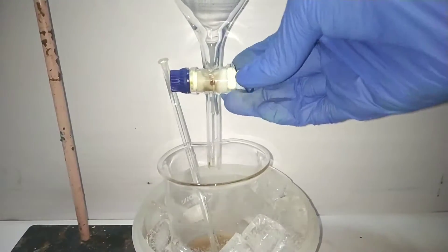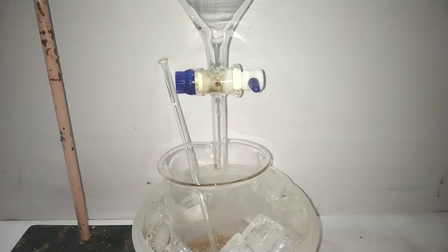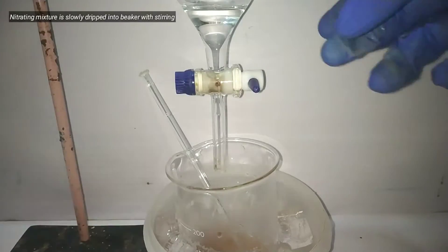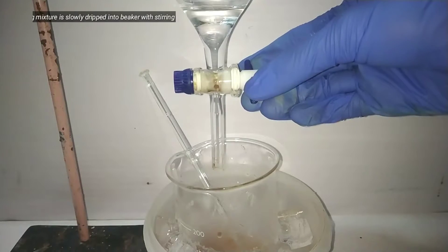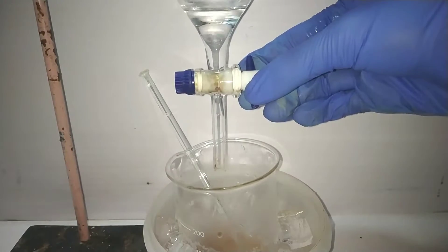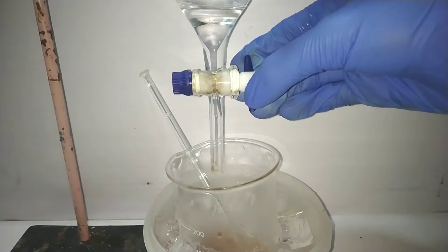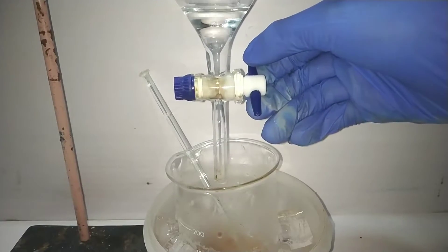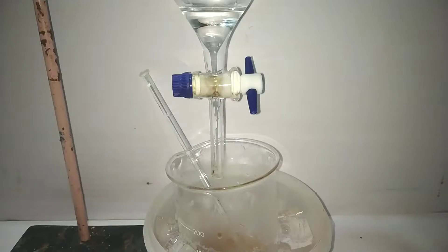The beaker was then placed in an ice bath with a separatory funnel attached on top. The separatory funnel was filled with pre-chilled nitrating mixture containing 5.5 ml of concentrated 68% nitric acid and 3.5 ml of concentrated 98% sulfuric acid. The knob of the funnel was adjusted so that the nitrating mixture falls into the beaker at a rate of 1 drop per second.